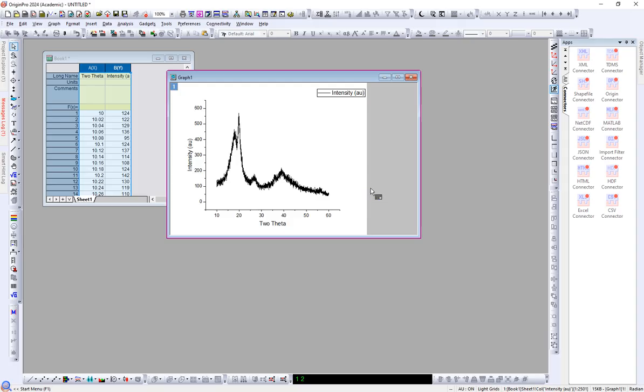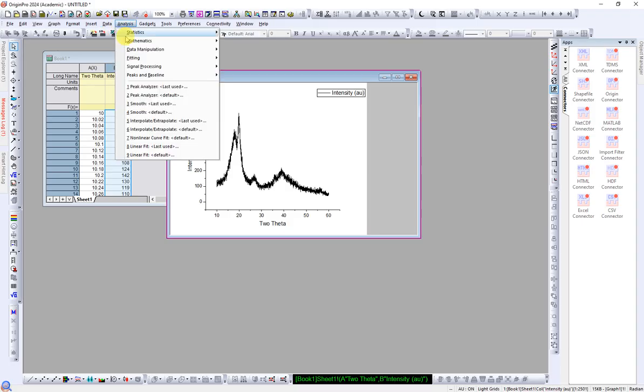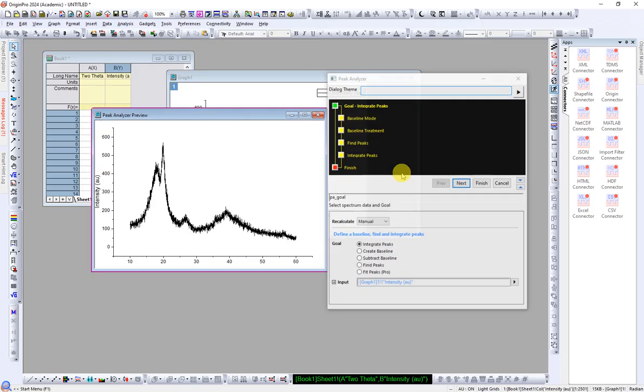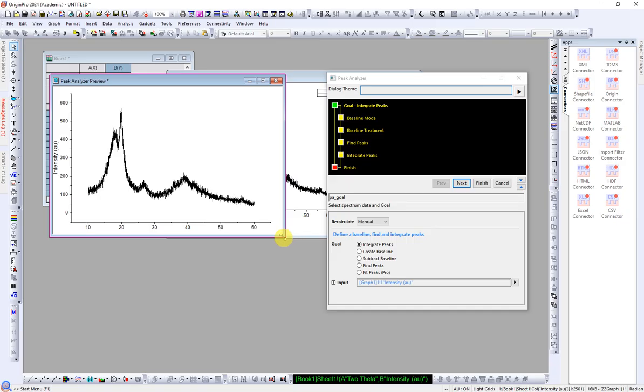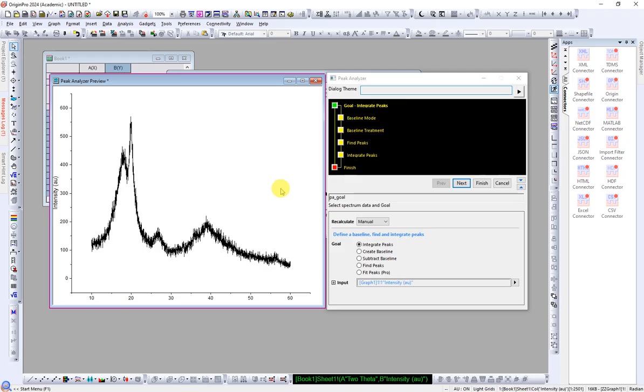So after I have drawn the graph, you see there is a lot of noise. So the first step is you can remove the noise if you want. I have made a separate video on how to remove this noise and make the curve smooth. So in this video I will only focus on baseline correction. After you have drawn the graph, click on Analysis, Peak and Baseline, Peak Analyzer, Open Dialog. Okay, now a new window is open and this is the preview of the graph. If we make any changes, it will appear here. So let's make it large.